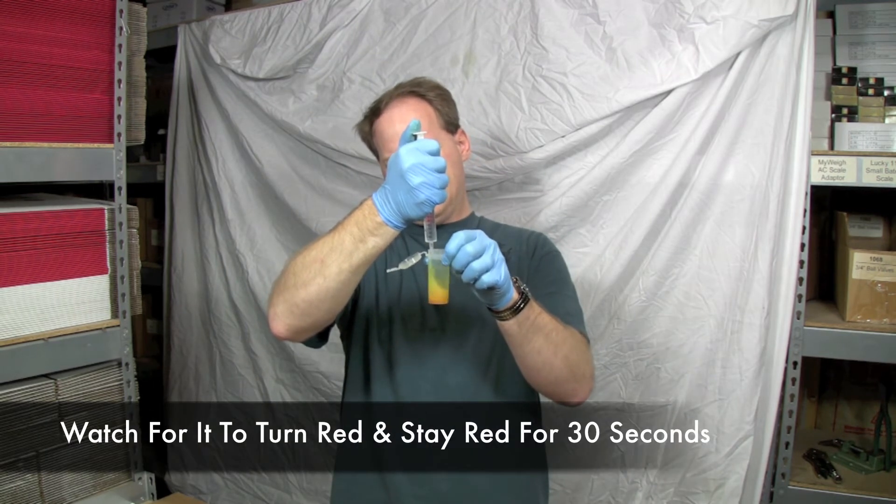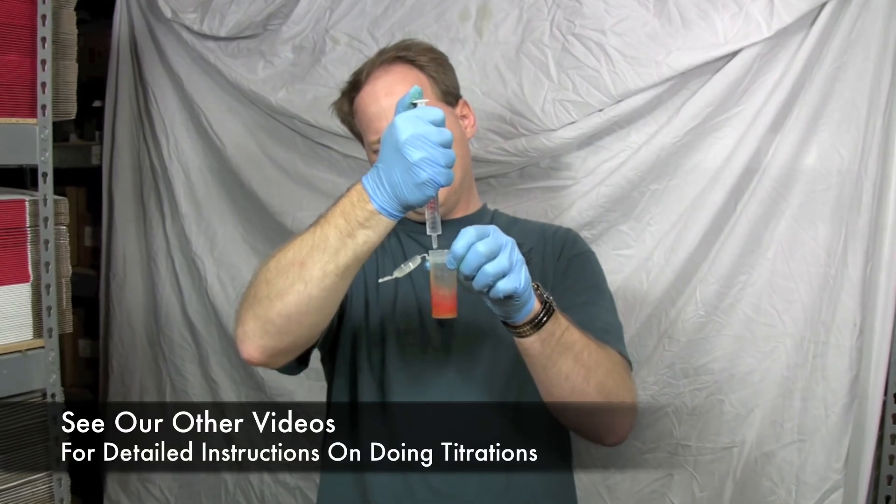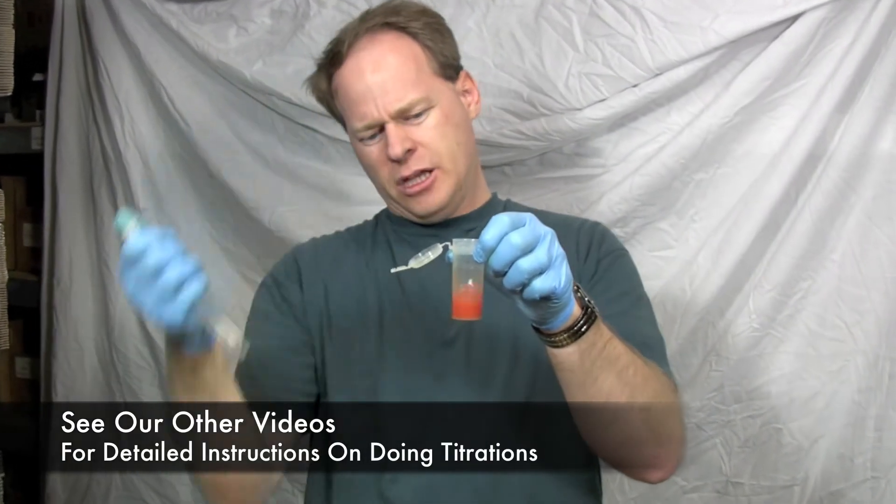See it go into that red color? It looks very similar to what we did earlier, only on a much, much deeper red. I just want to show you the difference between phenolphthalein and turmeric.